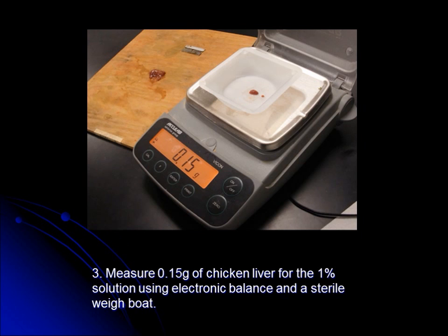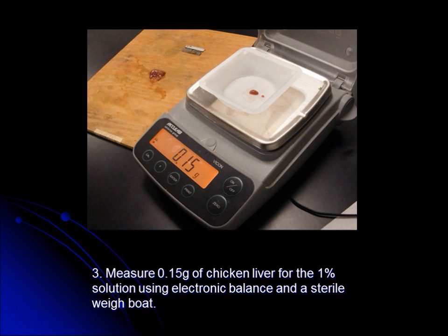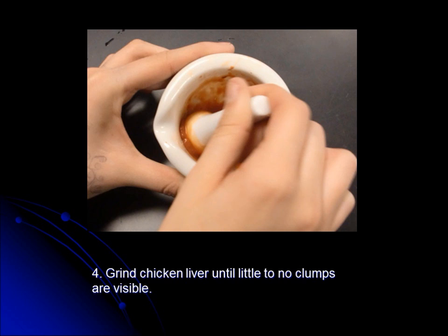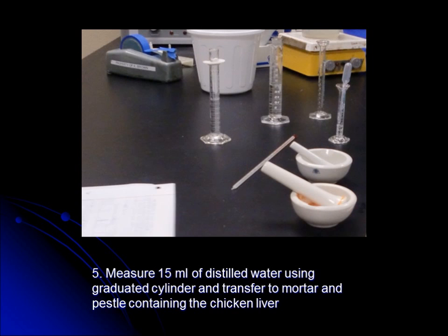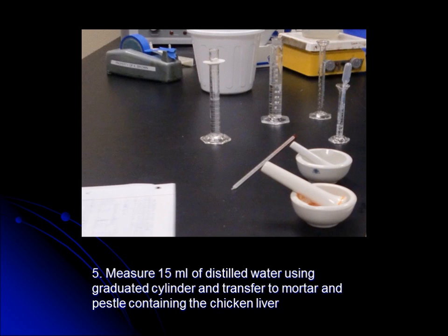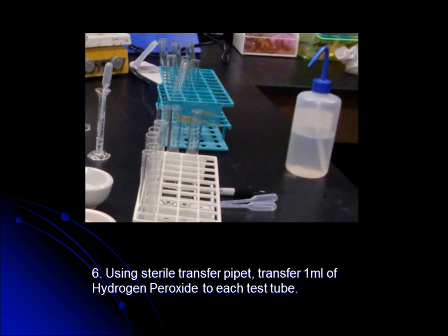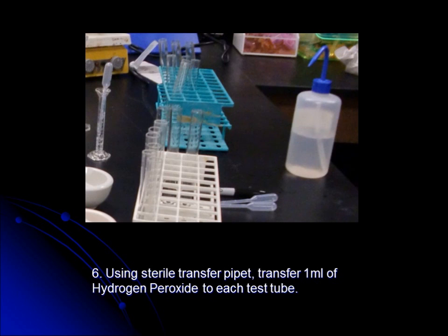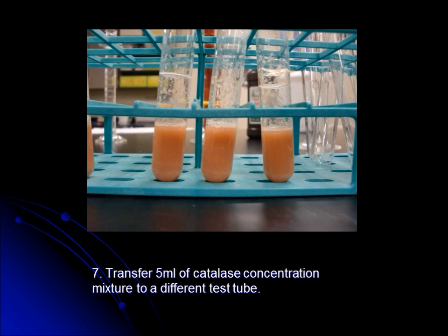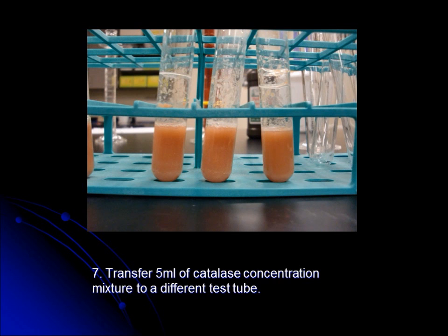Step 3: Measure 0.15 grams of chicken liver for the 1% solution using an electronic balance. Step 4: Grind chicken liver until little to no clumps are visible. Step 5: Measure 15 mL of distilled water using a graduated cylinder and transfer to the mortar and pestle containing the chicken liver. Step 6: Using a sterile transfer pipette, transfer 1 mL of hydrogen peroxide to each test tube. Step 7: Transfer 5 mL of catalase concentration mixture to a different test tube.